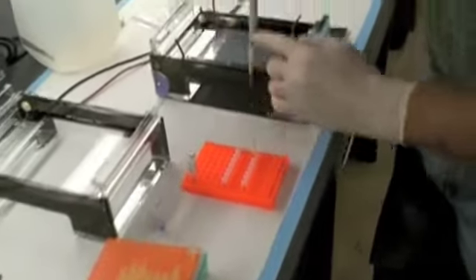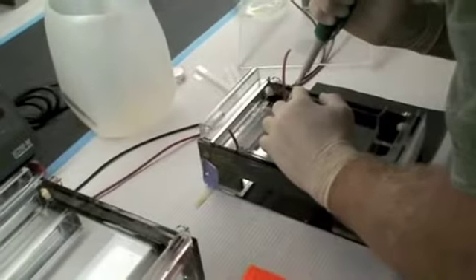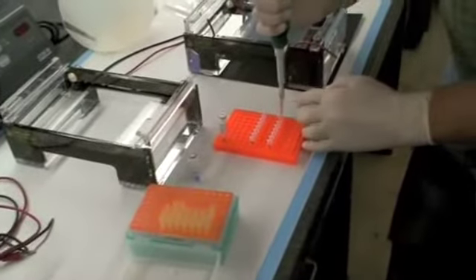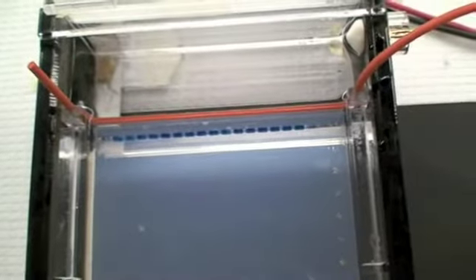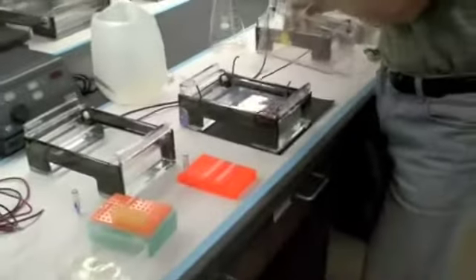It diffuses more than your sample does. Your sample doesn't go very far. But sometimes I worry about how that color change looks between the first sample and the last sample. There's a lot of glycerol in the ladder. Probably could use a little bit more dye. So now we turn this on.